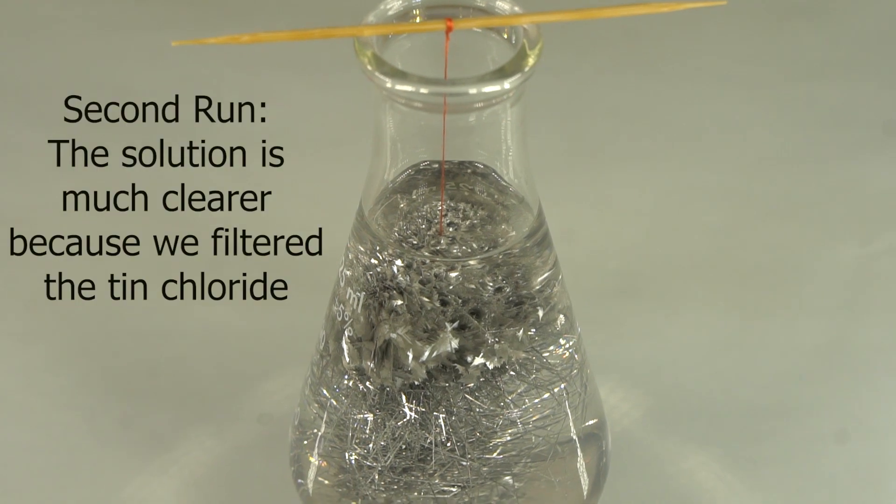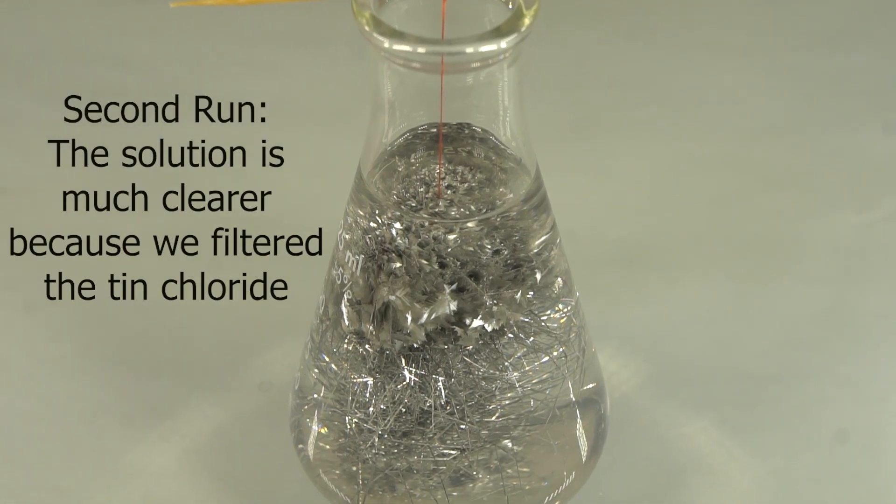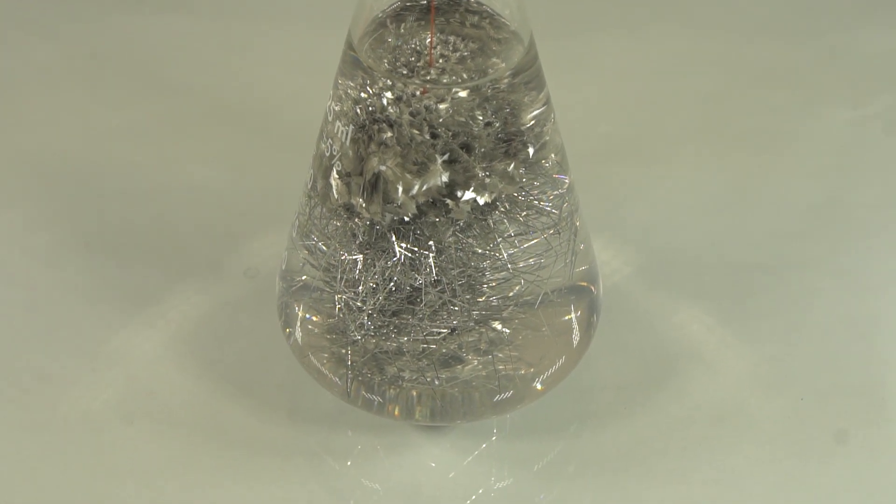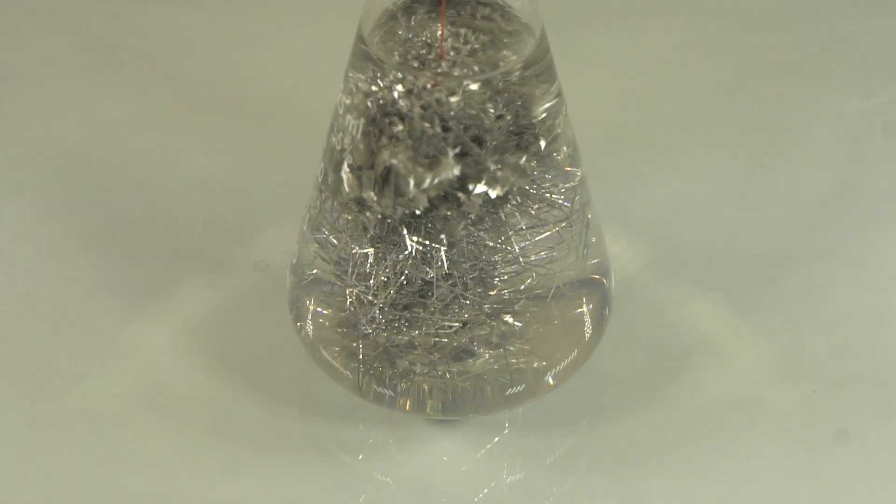In the second run, the crystals have remained in solution for several weeks, allowing us to admire them each day. Most of them remain in a beautiful needle-like silvery metallic state.